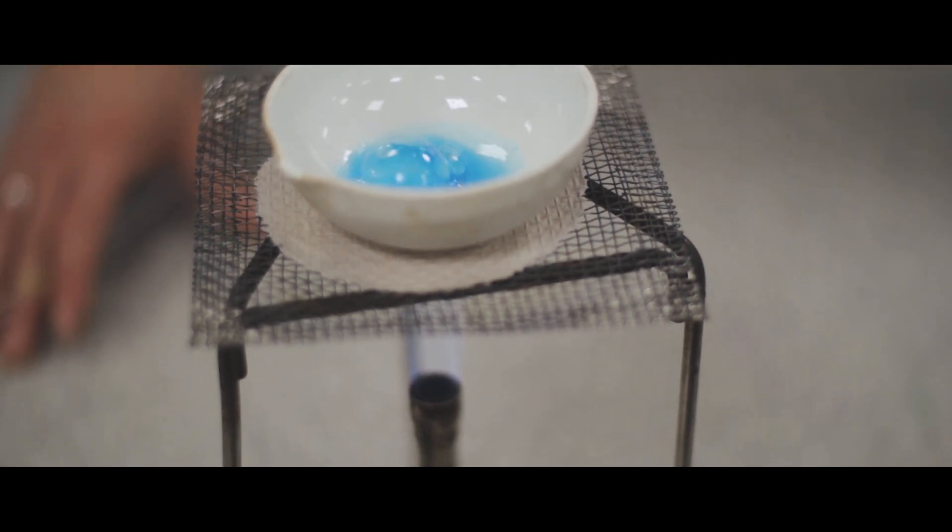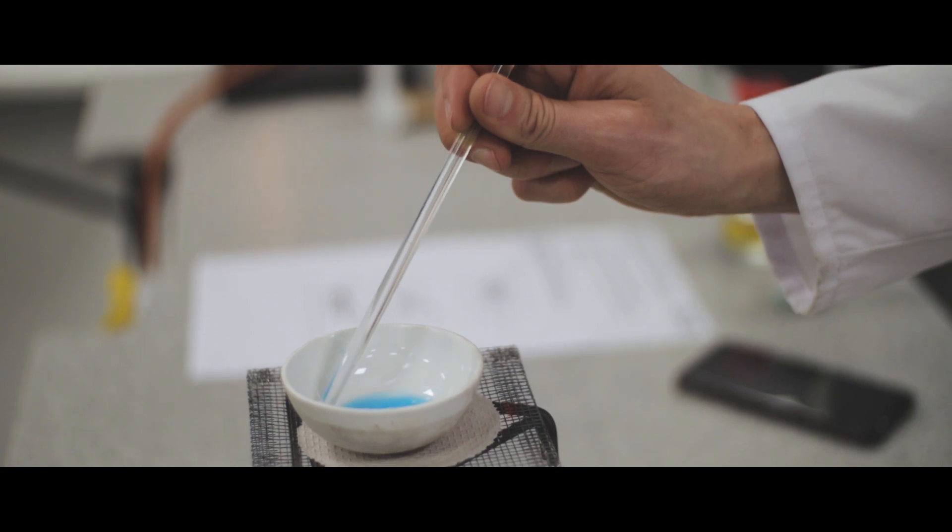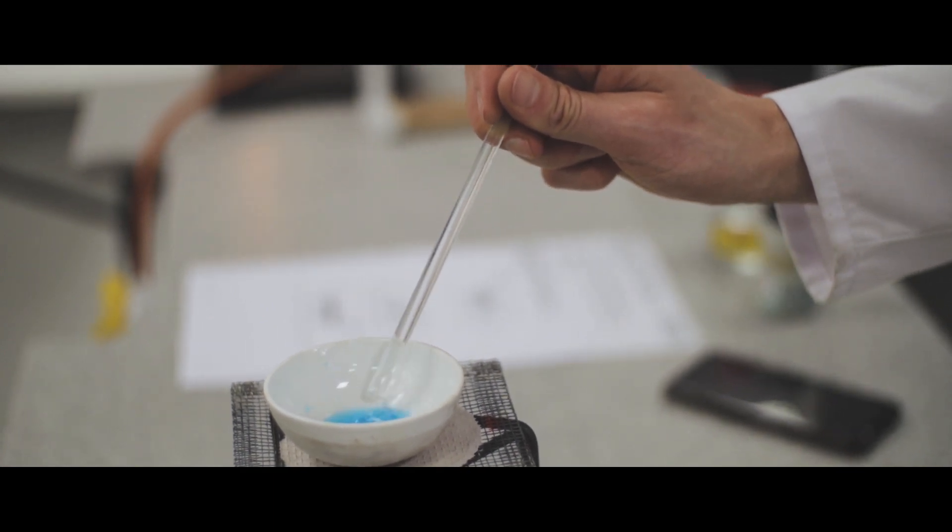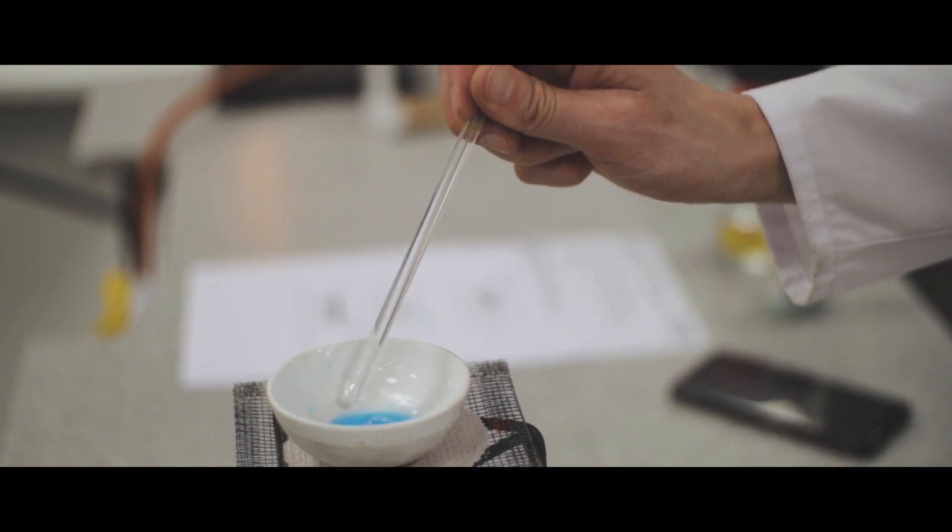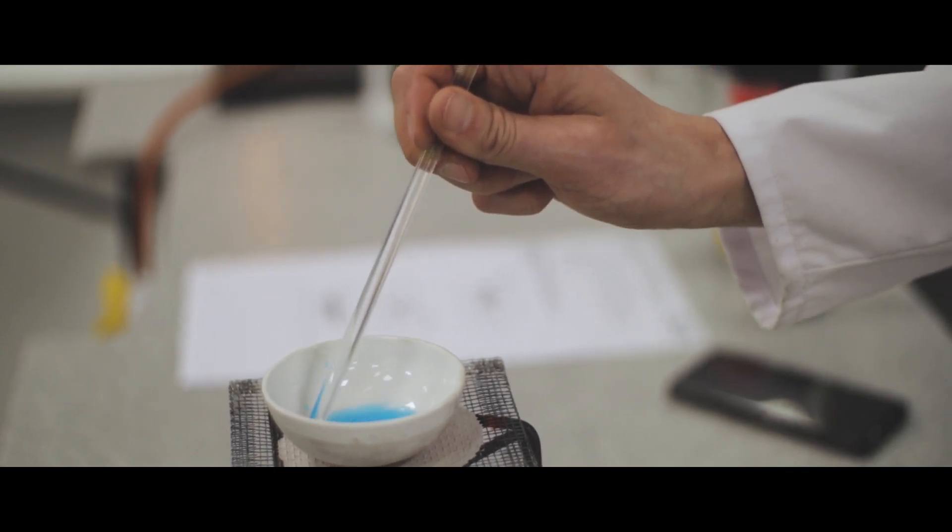We want to stop it just before it completely goes dry. So we'll see around the edge here bits of solid crystals start to appear.